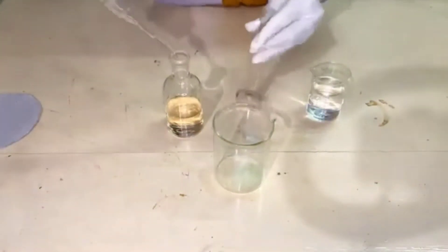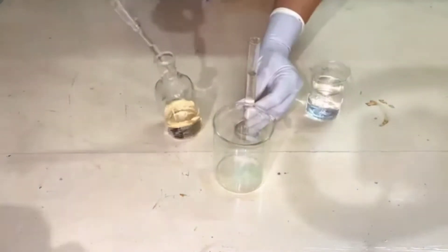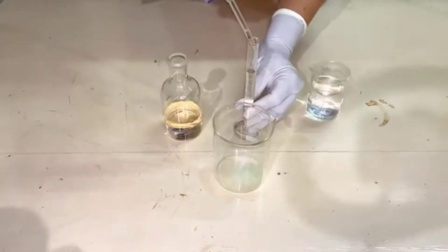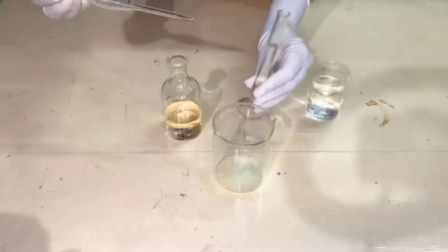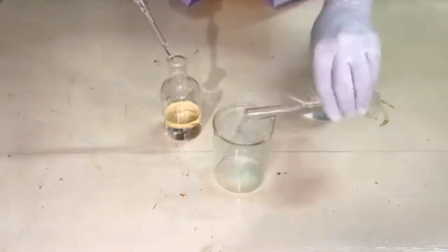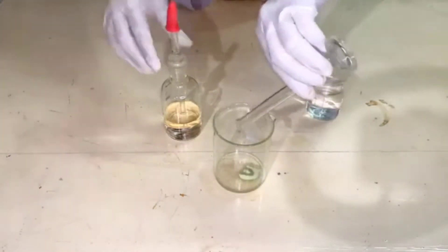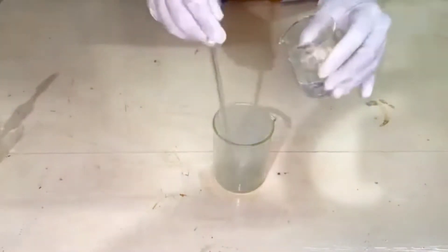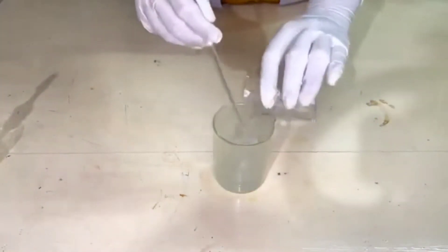For the preparation of Mohr salt solution, we calculated the amount of Mohr salt — approximately 2.4 grams per 100 ml of water. Pour the Mohr salt in a beaker and add 10 ml of concentrated sulfuric acid and 90 ml of water to the mixture with continuous stirring.